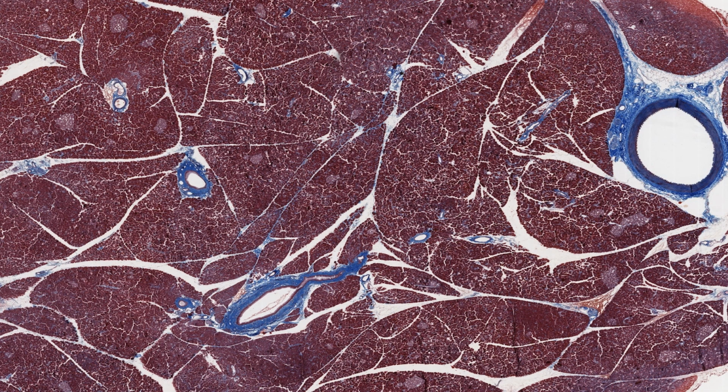Here is an artery and a large interlobular duct over here. The magnification is not high enough to see all the details, nor details of these smaller blood vessels and ducts scattered about.